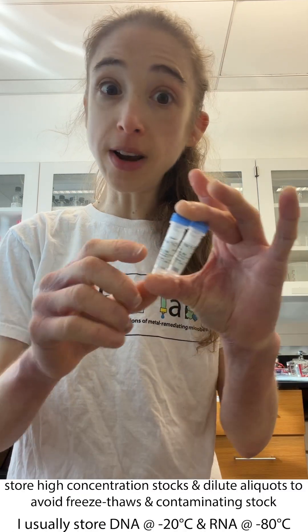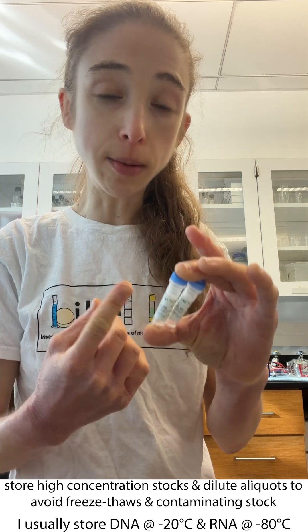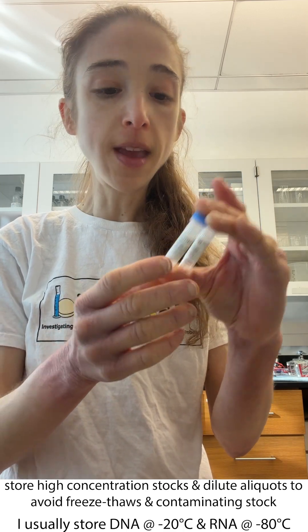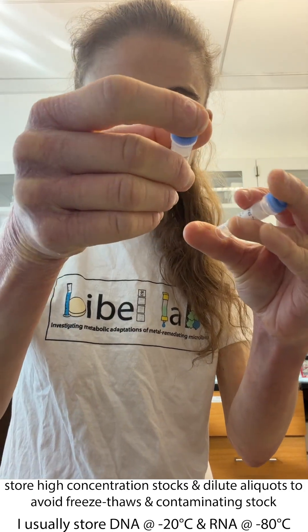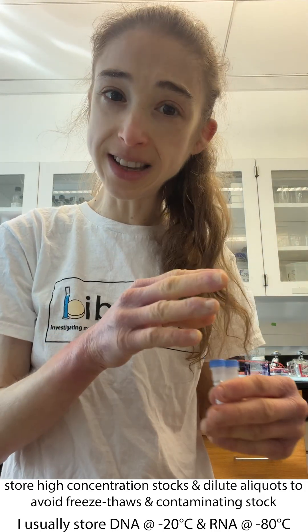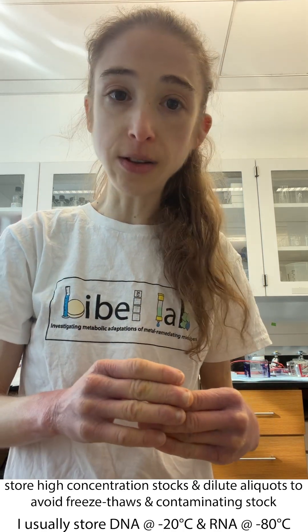Before you do any of that, make sure you spin your tubes down — give them a quick pulse spin so you don't have any powder stuck on top. It's going to be a really tiny amount in there, so let it sit for a minute to make sure it all gets dissolved, then go ahead and dilute it and aliquot it.